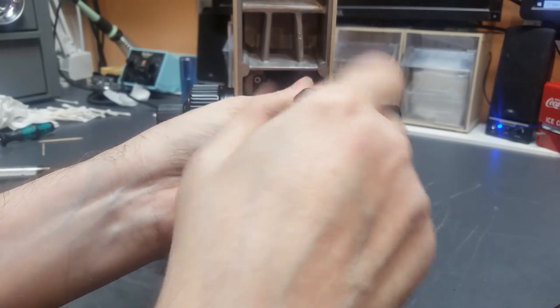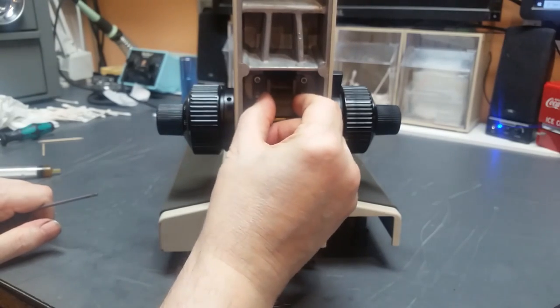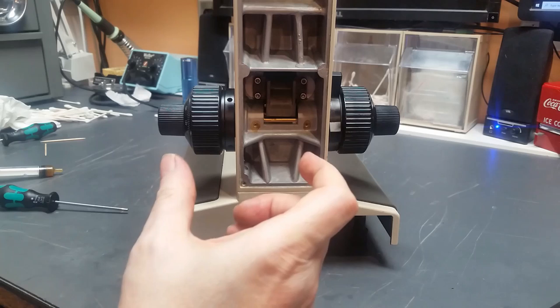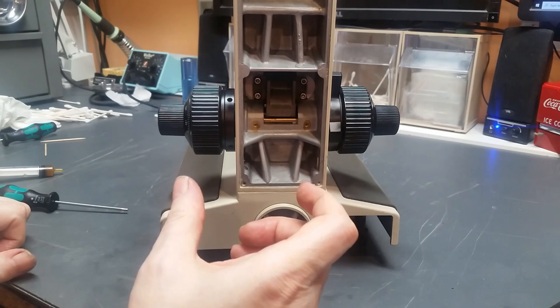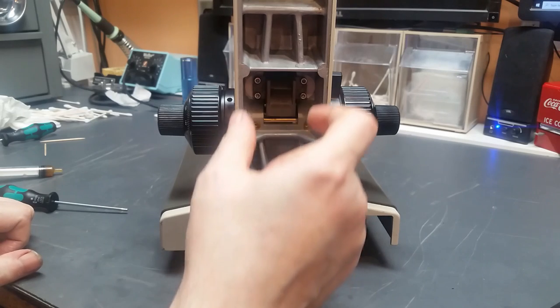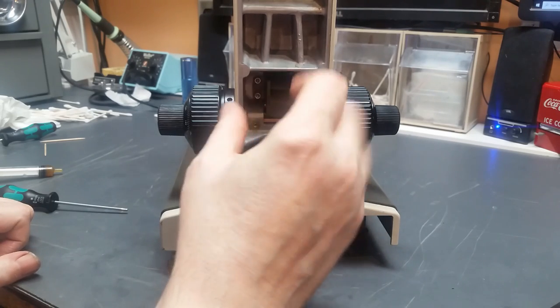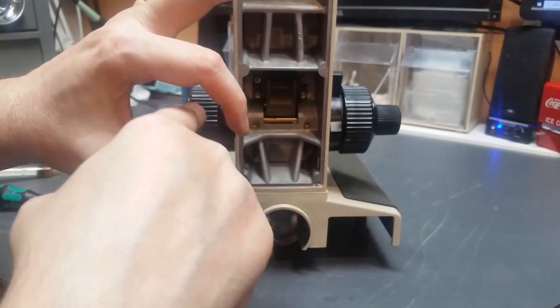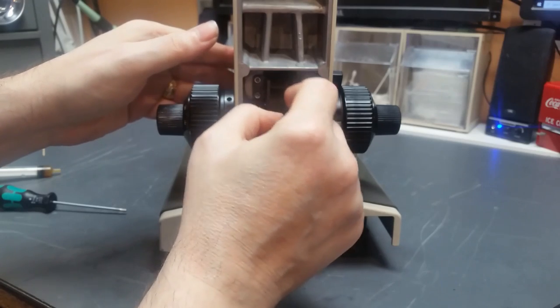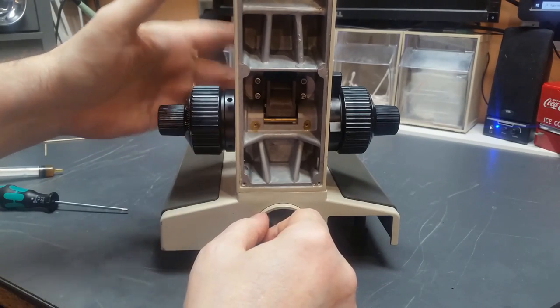And what that'll do is that'll let me reach in there and move this gearbox around. It has a certain amount of slack or movement, free play, because the holes that the screws go through are oversized. And what I want to do is move that and center it in both axes, horizontally and vertically, so that the screws are going right through the center of the holes and not up against them. And that will put this gearbox in proper position to mesh with that brass rack.